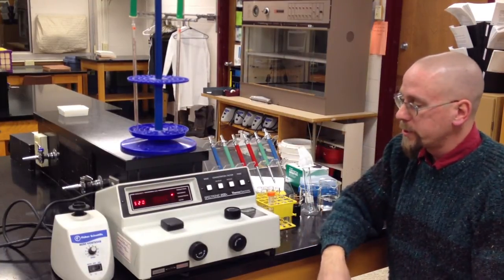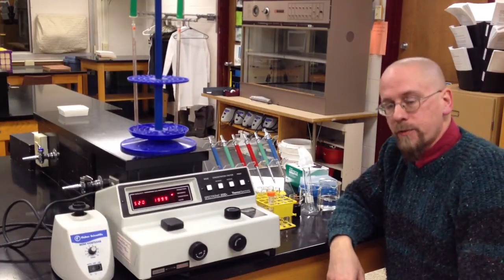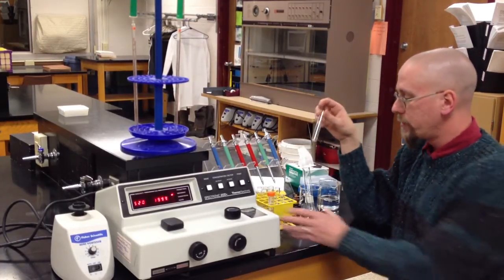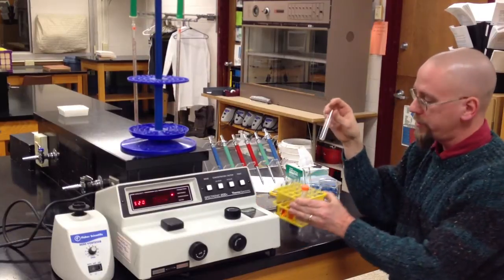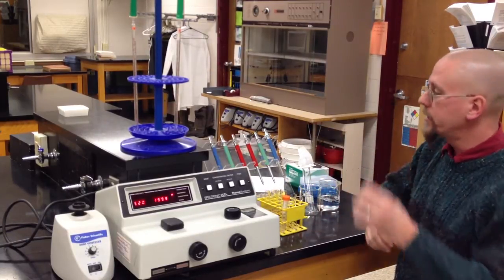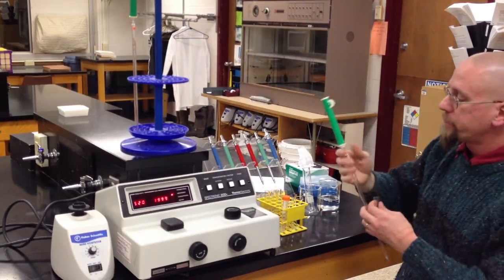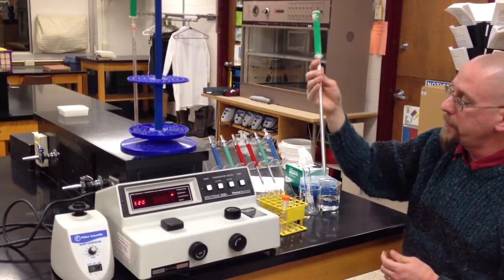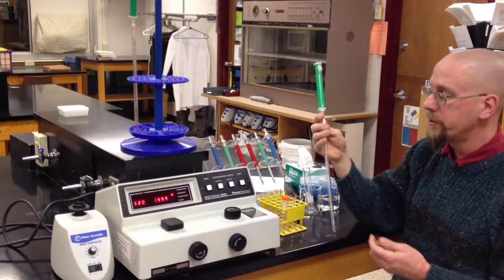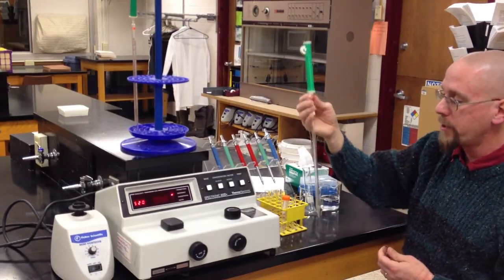What we need to do at this point is set up what's called a blank for the machine. You're going to have a rack here with a lot of test tubes. I'm going to grab one of these test tubes. According to your laboratory protocol, you are going to use a pipette.